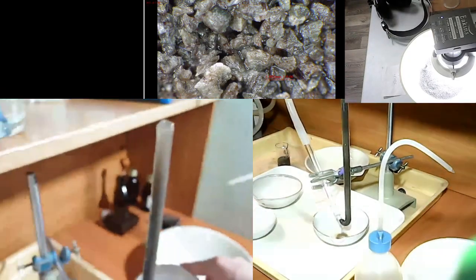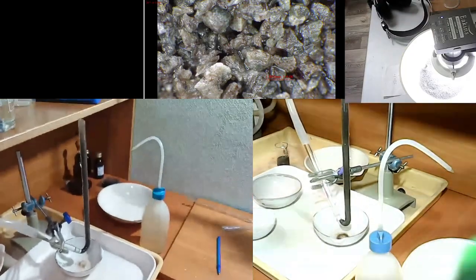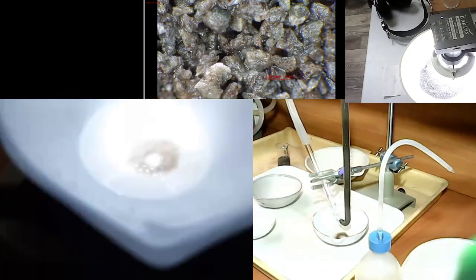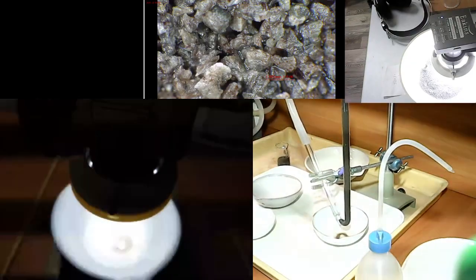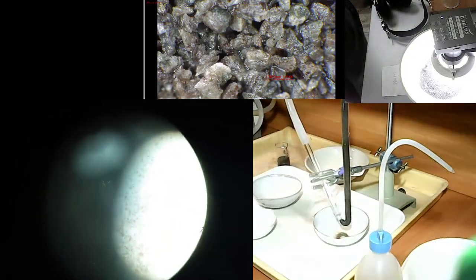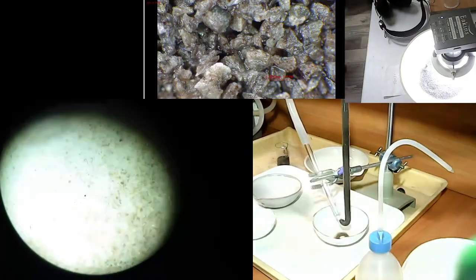We can see that the process has started. These pulses are now being transported to the tube from the water pump, specific water pump, which is hydroseparator, water flow regulator, we call it WFR. And so you can see that particles have started to come down from the GST onto the white dish. Each time this dish is monitored under the mic.